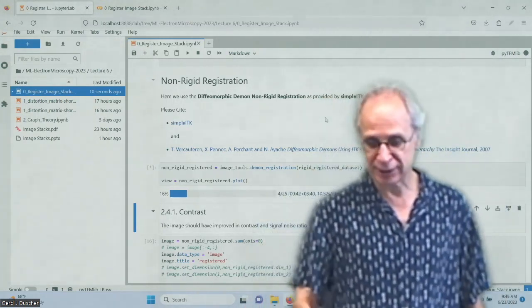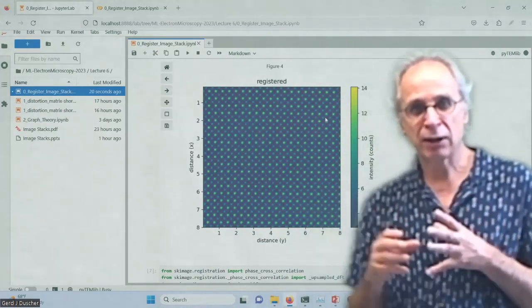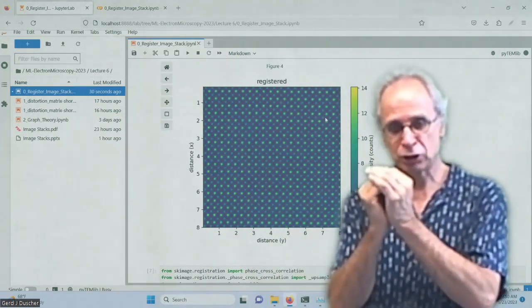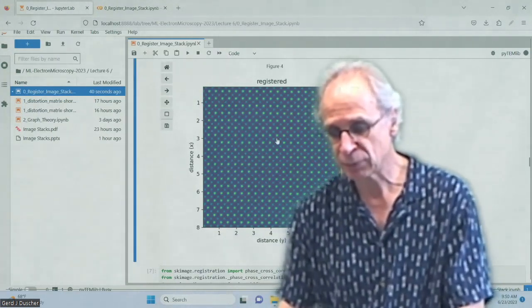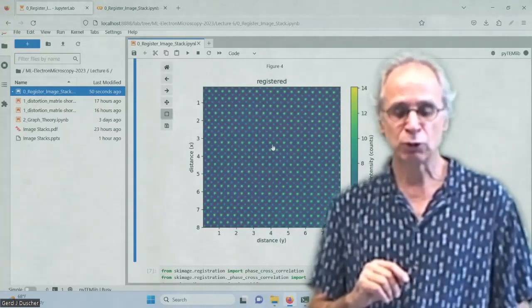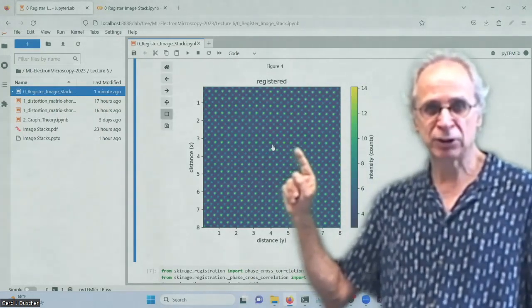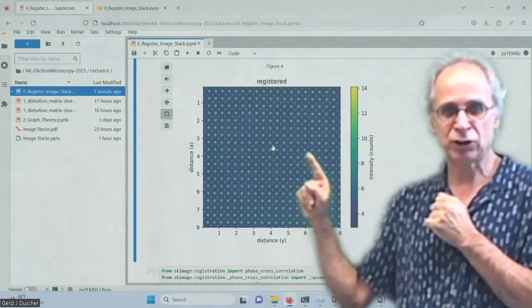So what are we doing there exactly? Let's go back and look at this image. So this is the starting image. And because I averaged over the whole stack here, the assumption is now that the atom stands around randomly. So all the random distortions are averaged out, and my position of the atom is where the atom position is, or where the contrast in the image is. Okay, I can't do anything right now because it's doing my demon registration. So I have a contrast in the image, and this is where it's averaged out, and so the demon registration now determines the distortions so that it is fitting the averaged image.